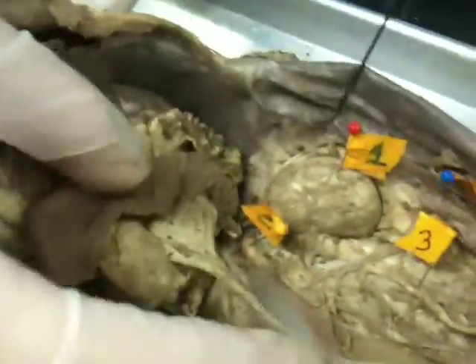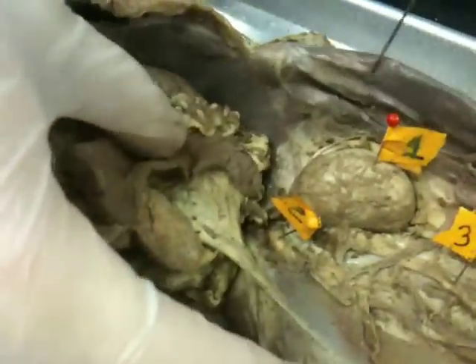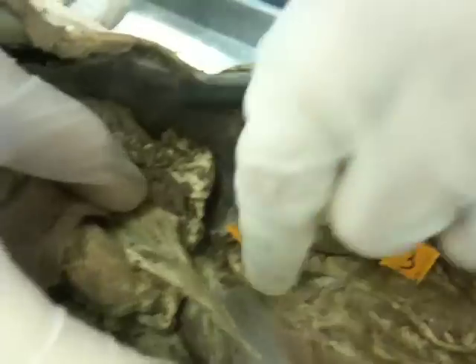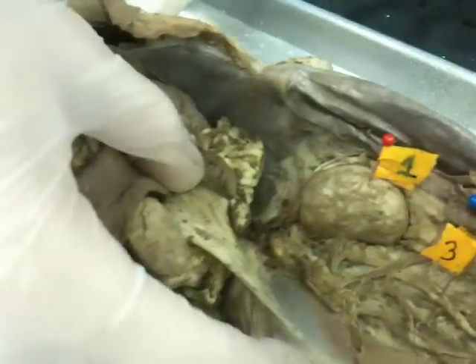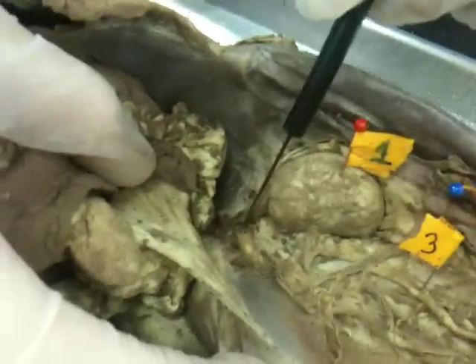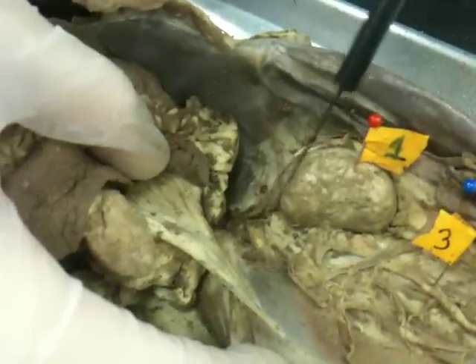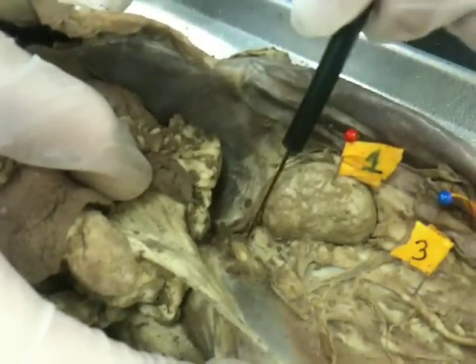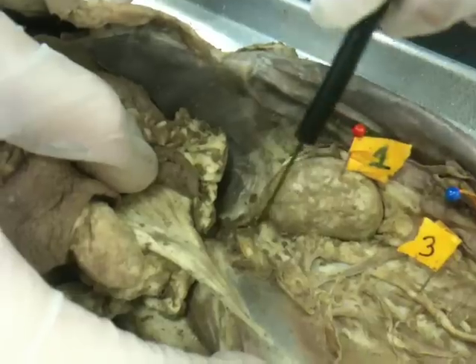Next, we go on to the suprarenal glands, or adrenal glands, which are these small kidney-hat bean-shaped structures right here, right next to the kidney. This here is the adrenal gland.